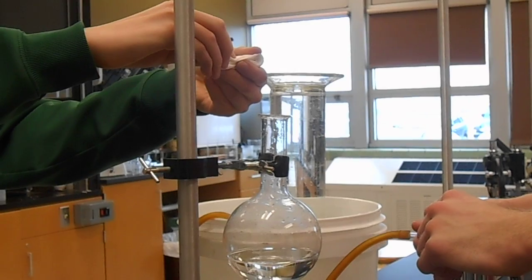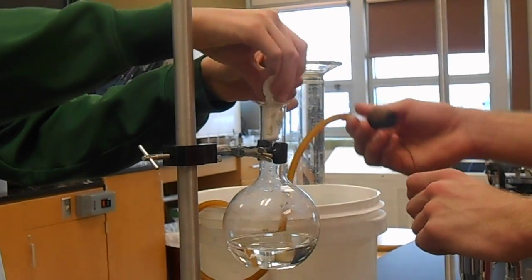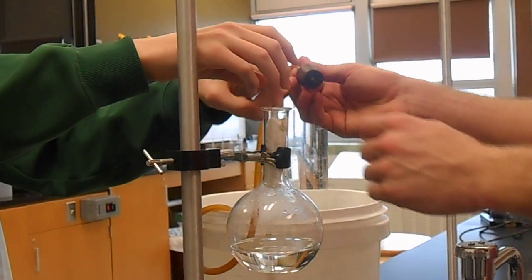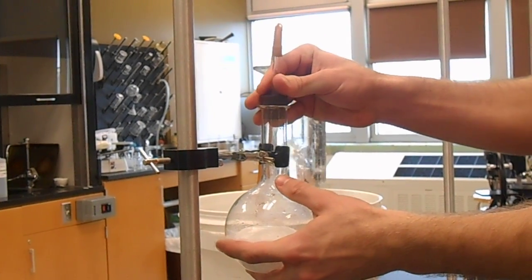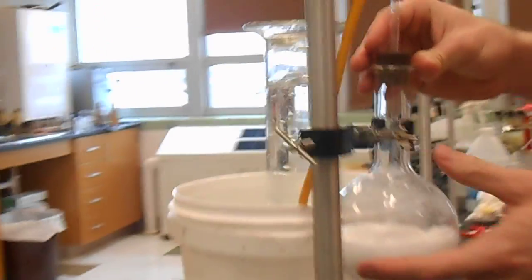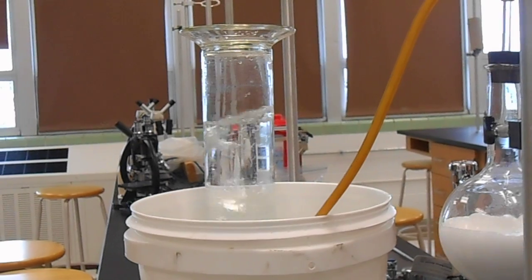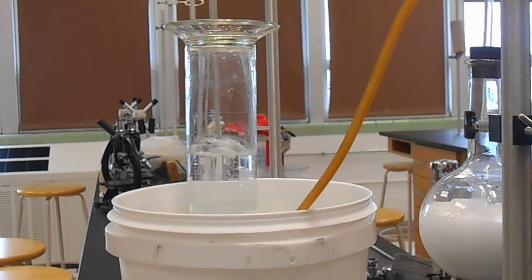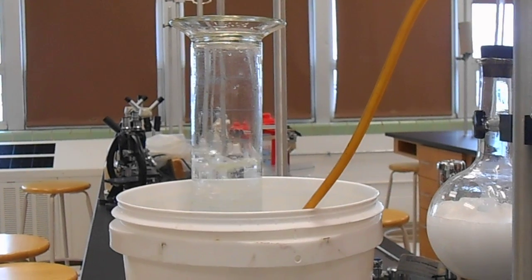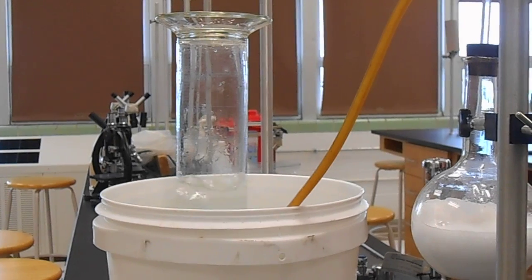Vanna, please add the sodium bicarbonate. As you can see, the reaction is vigorously producing carbon dioxide gas, which we are capturing very trickily in our bucket-slash-graduated cylinder apparatus.